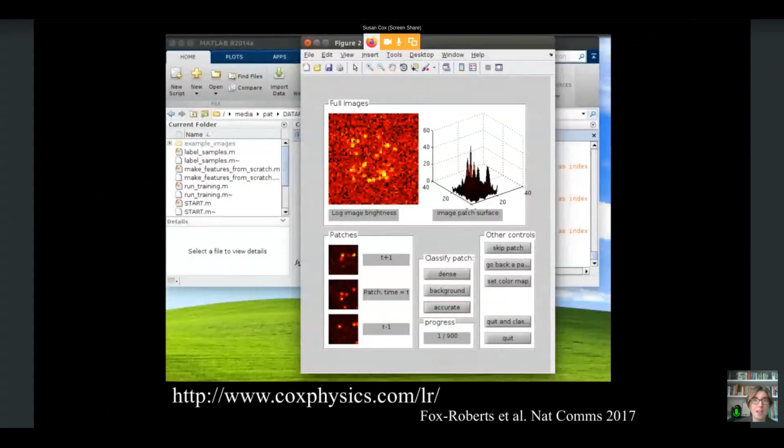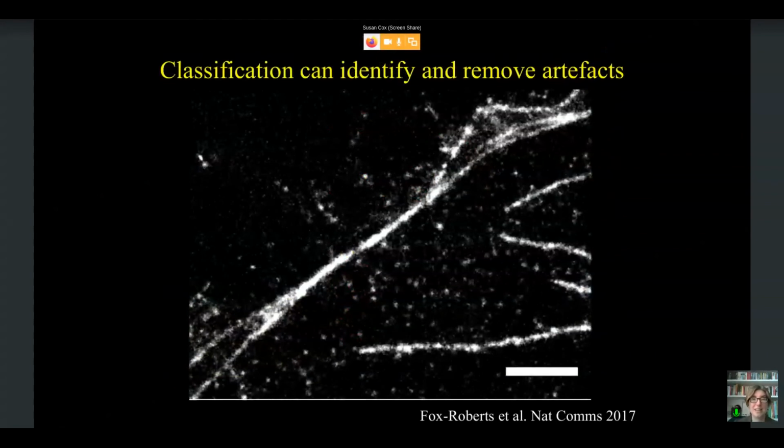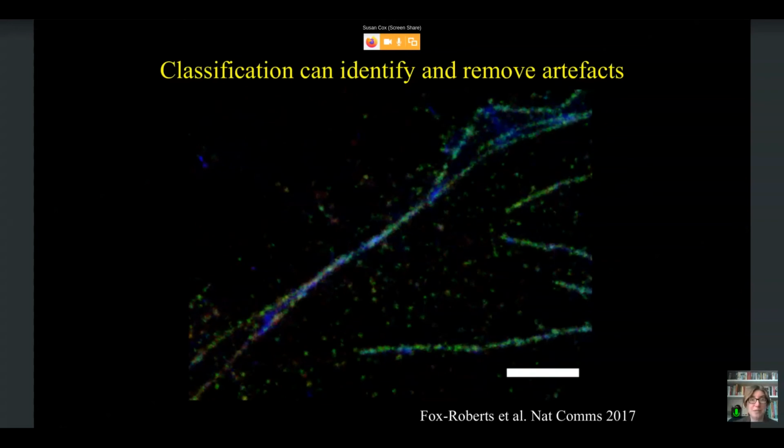So we first attempted to tackle this with a machine learning approach where a user identifies poor fits. We did this because it turns out even undergraduate students are far better at identifying poor fits than any of the automated systems available at that time. And that worked pretty well. Using a classification that a person had input for that particular type of image, it could classify whether a fluorophore would be successfully fitted or not. We were able to take data like this and reclassify, with the good classifications in green. You can see that removing the poor classifications in blue takes away the artificial sharpening that we see in this structure, which, since it's tubular, we wouldn't expect to get broad areas that are blurred over.